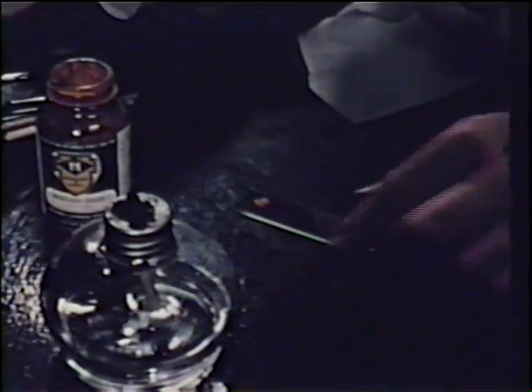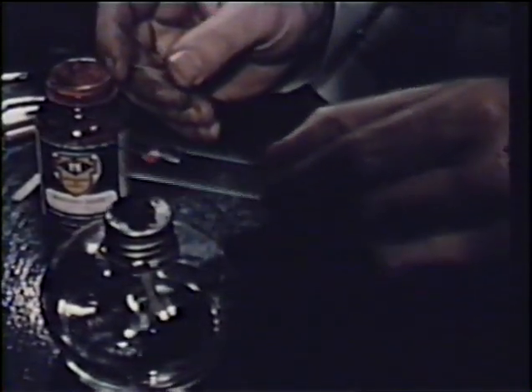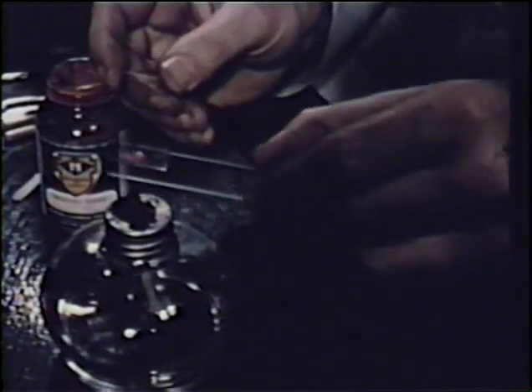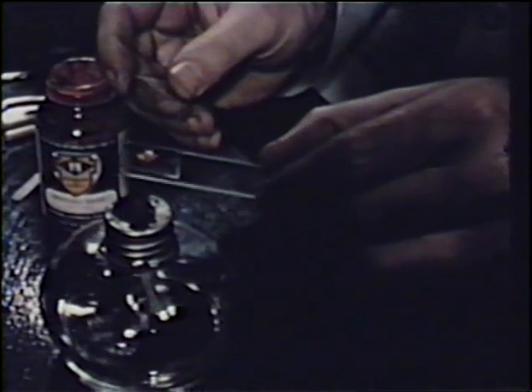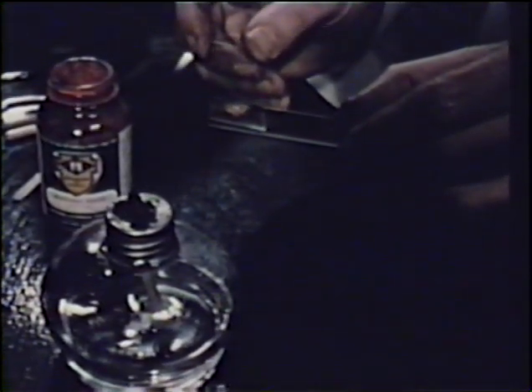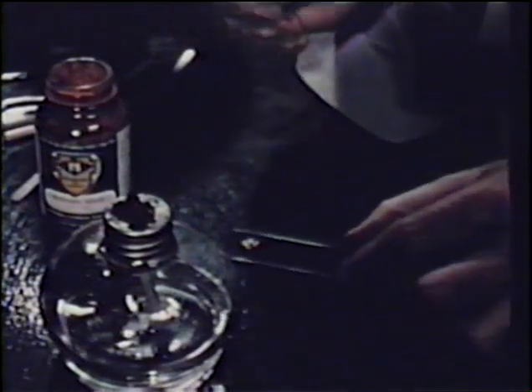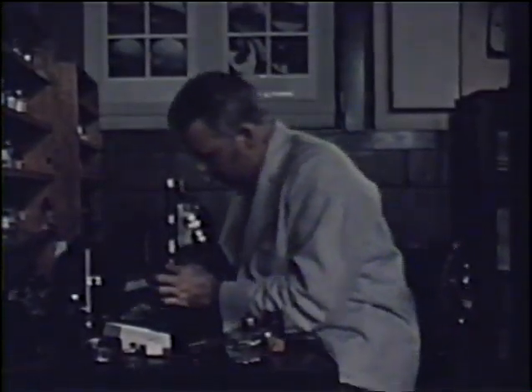Here we are about to see one of the simplest operations, sublimation. A small portion of the material is heated on one slide so that the sublimate condenses on a second slide above it. These crystals of mercuric iodide are typical of the type of sublimate obtained in this way.